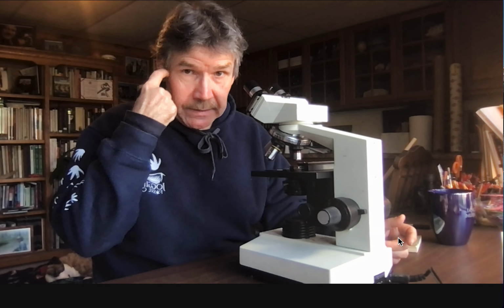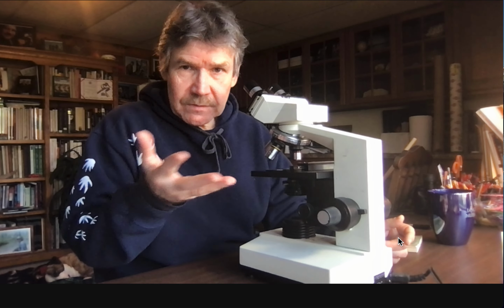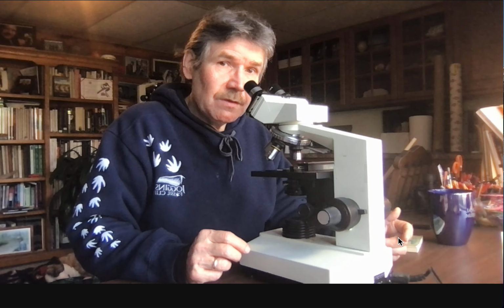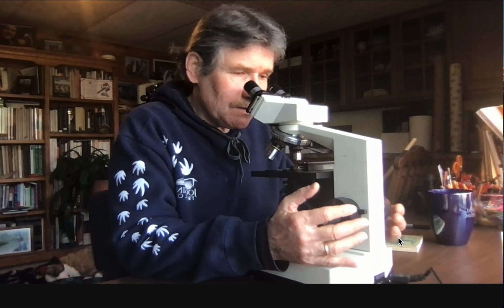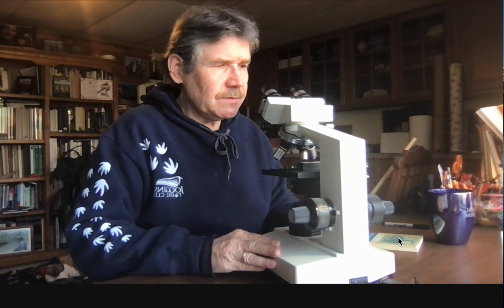Now that is sort of a requirement for all my classes, that students can use a binocular microscope and see one clear image. As always, if you have any kind of difference about your physical abilities, let me know privately. We'll talk about it and we'll figure out if there's something that we can do. Okay? But for most of us, maybe take our glasses off and this will work better. So right now, this is well adjusted for me as far as the distance goes.